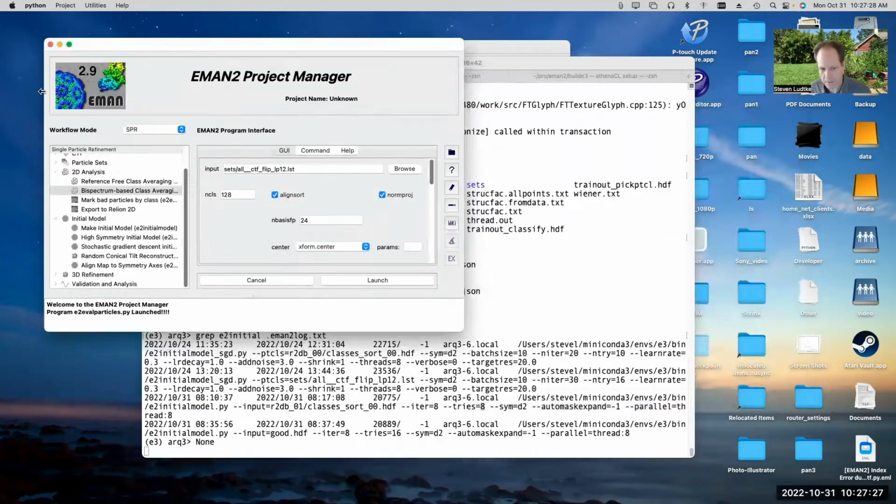It's not part of the GUI yet. So if you look in here under 3D refinement, I don't think we have the new refinement there. In the subtomogram averaging, which we're going to talk about next week, we do have the new subtomogram averaging programs all integrated into the GUI, but we haven't done it yet for the single particle.